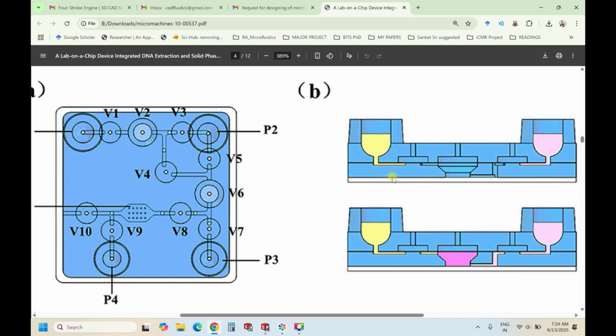Similarly for V6. Here they have not mentioned V6, only this layer of sectional view is mentioned, and that makes it difficult for the reader to understand the geometry. Keeping it simple, the authors want to tell that this is a 3-layered channel. That is the reason they have differentiated with different colors. This is the first layer. The bigger circle that we are seeing is the outer dimension, the circumference of this. Next is the second layer. All these channels which you are seeing are in the second layer, and whatever these circles are, they are in the top layer.